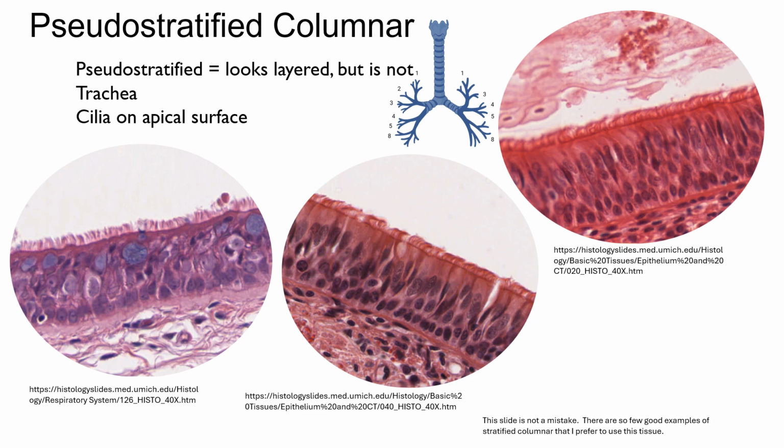Ha! You thought this slide was going to be stratified columnar. It's not. It kind of is, kind of. That's what pseudo means in the prefix of this word here. It's kind of stratified. Pseudostratified columnar has columnar-shaped cells, and they look stratified, but they are not. That's not many layers there. I know it looks like it, but it's not. The basal surface of each cell touches the basal layer, touches that basement membrane, which is like the barrier between the epithelial tissues and the connective tissues below it.